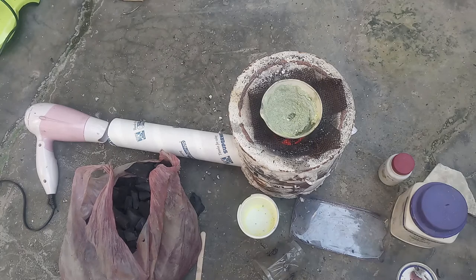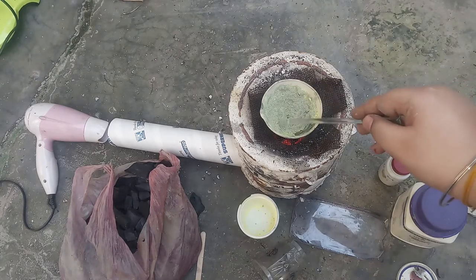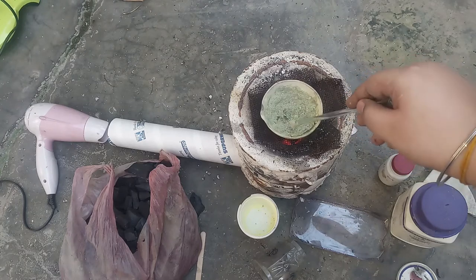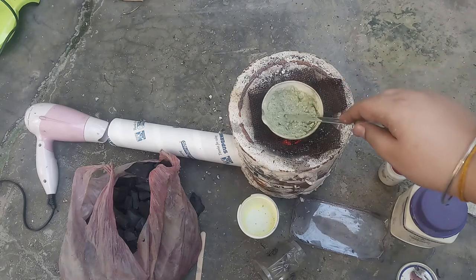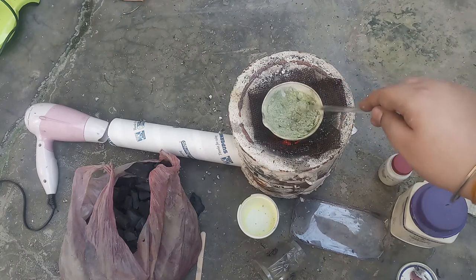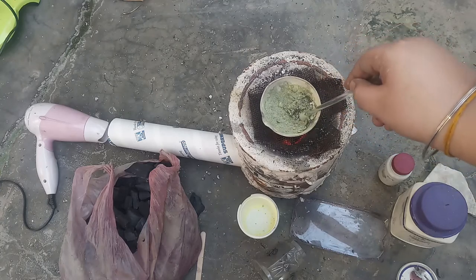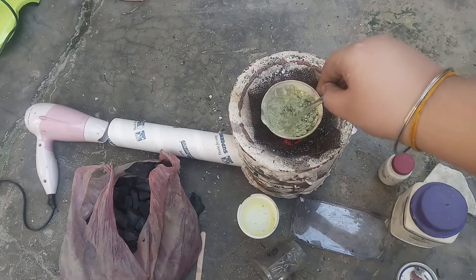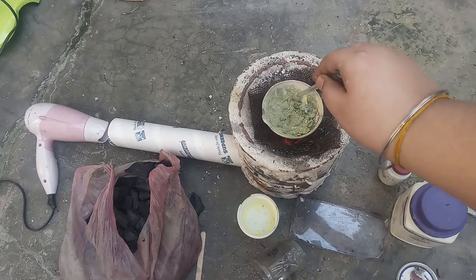See, it's melting and it's reacting. It's been formed into clumps — I never tried this reaction before. It should reach 400 degrees Celsius, which is the melting point of zinc, so it's reacting.